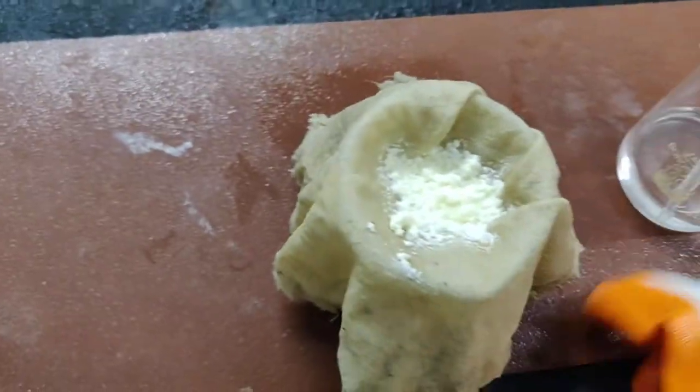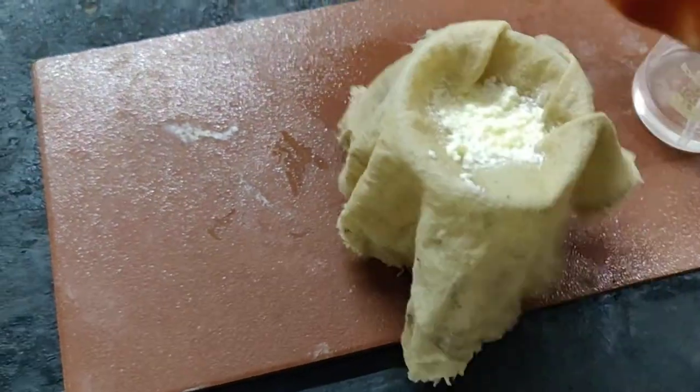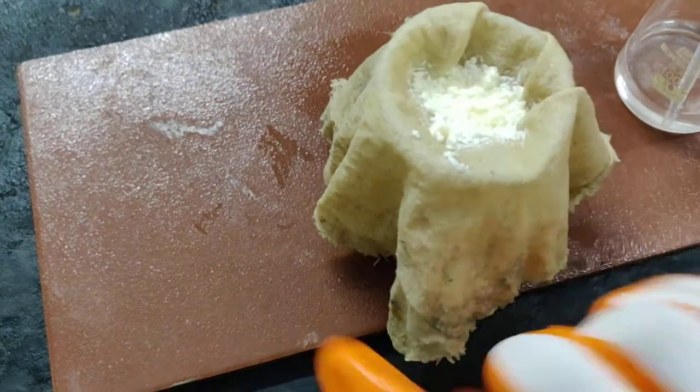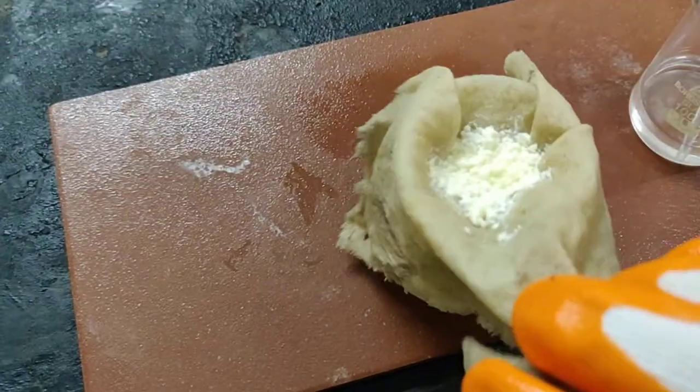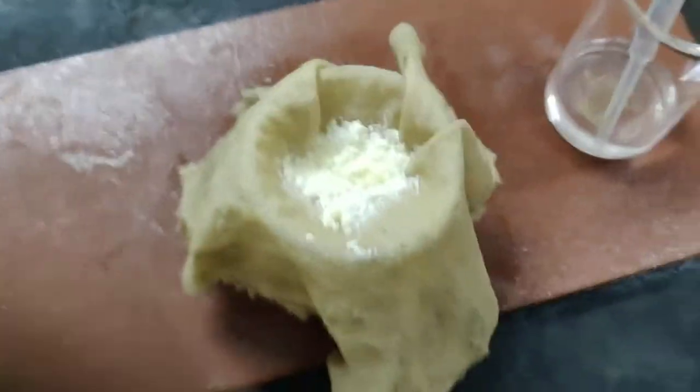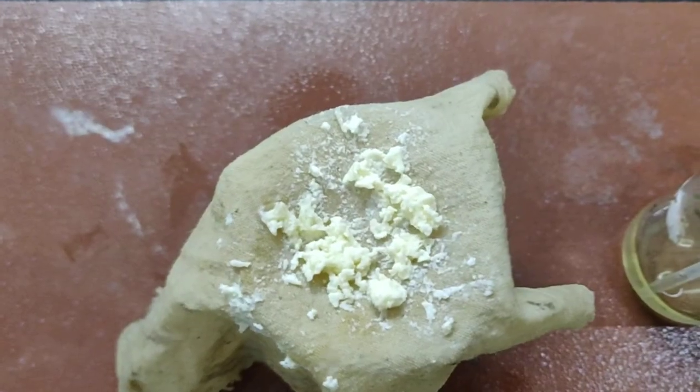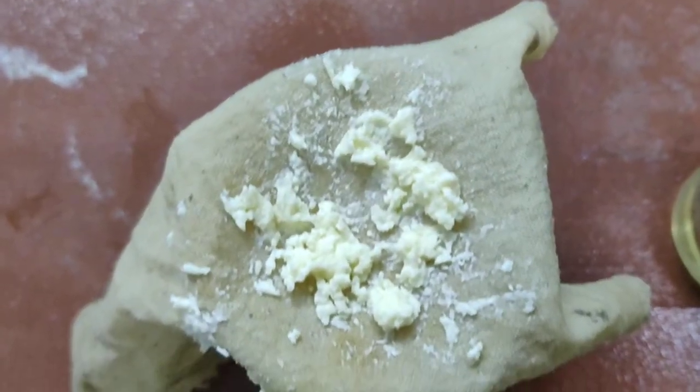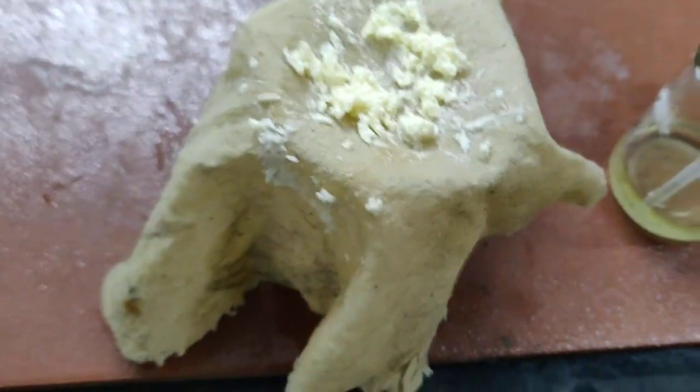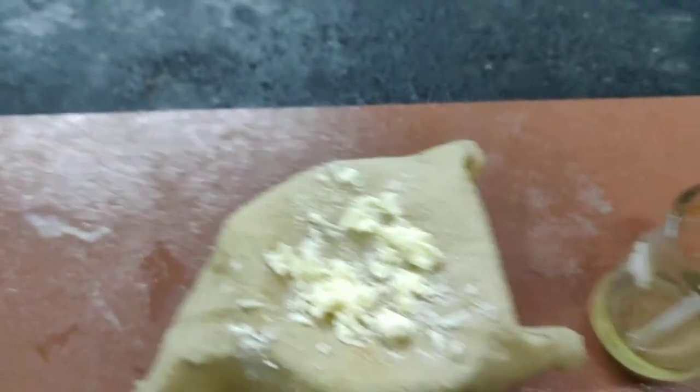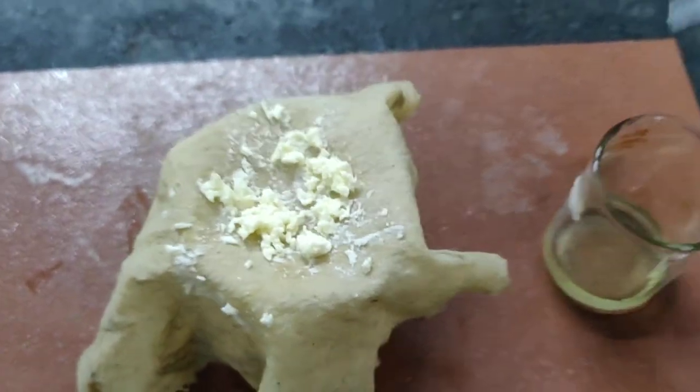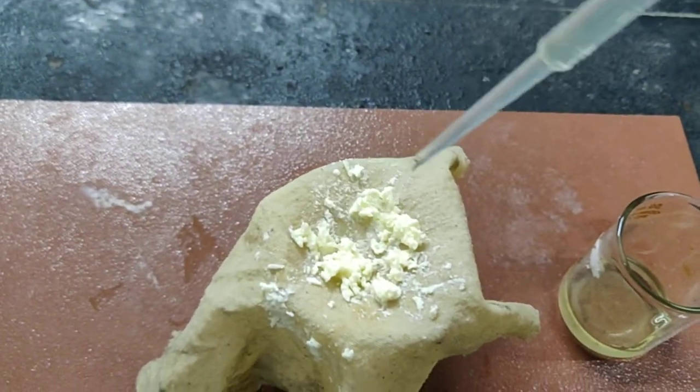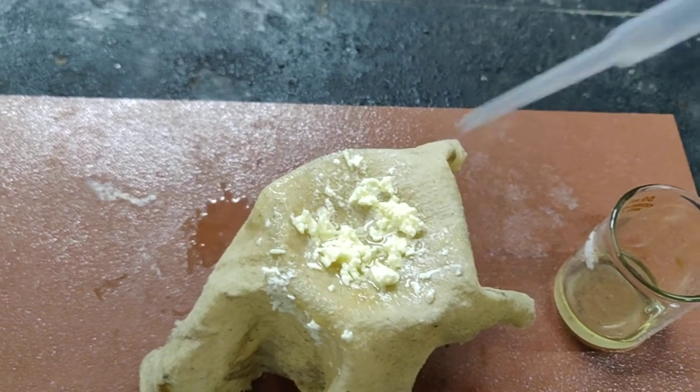And then we are going to squeeze it. By collecting the ends, we are going to squeeze it. I shall squeeze it and show you how it looks. See, the casein has been squeezed dry. Now we are supposed to add a little bit of alcohol to remove the adhering fat substances in it. So just add a little bit of alcohol. That should be sufficient.